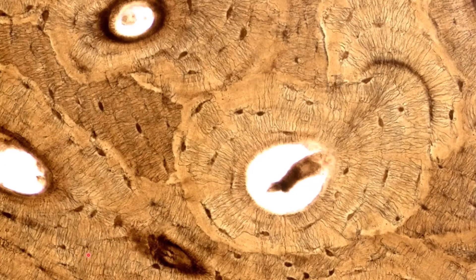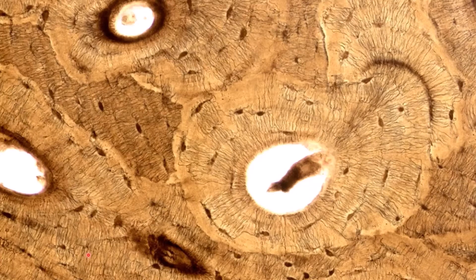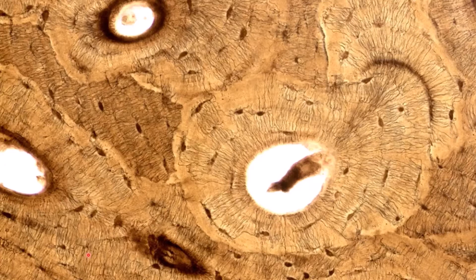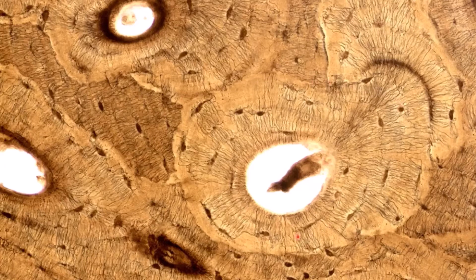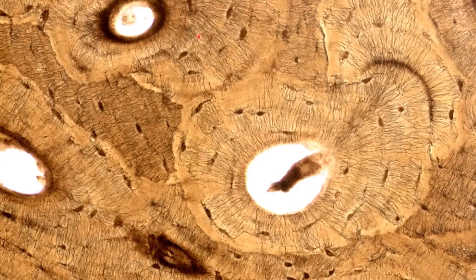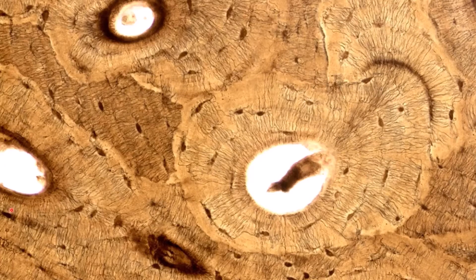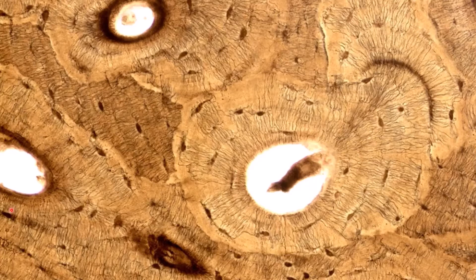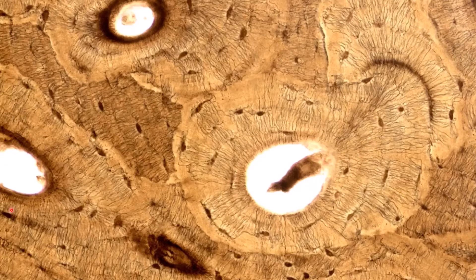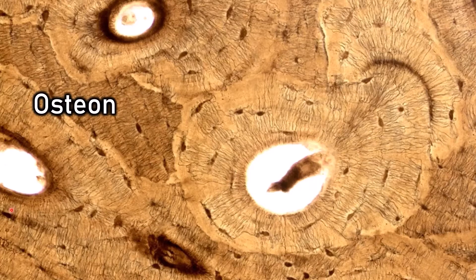This slide is showing us compact bone. You should notice all of these circular structures. Each of those individual circular structures is called an osteon, and an osteon is the structural unit of compact bone.